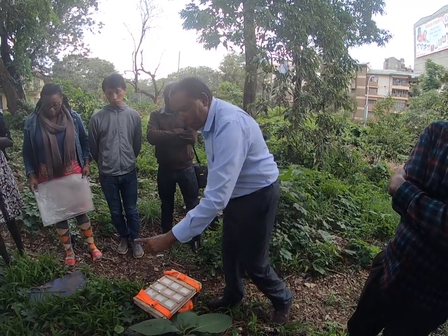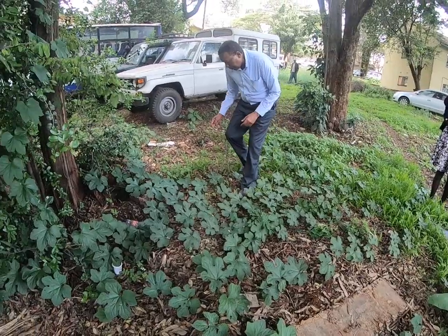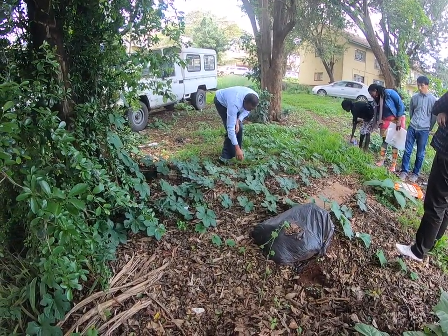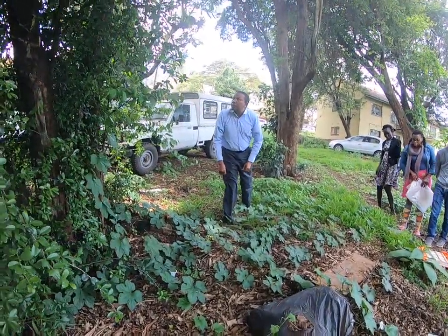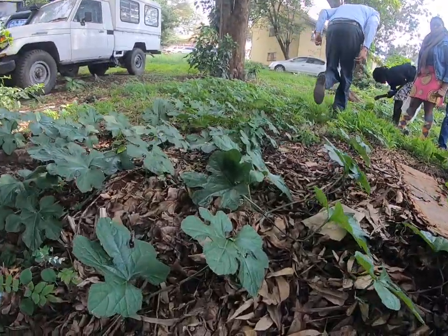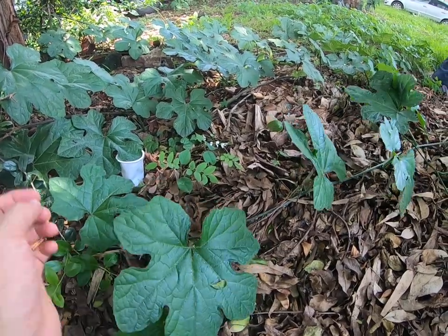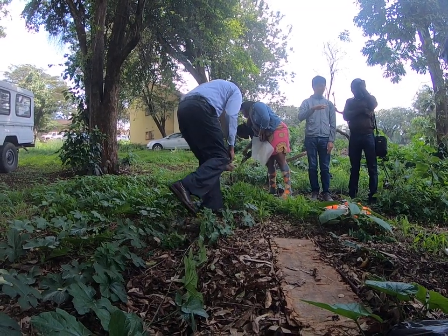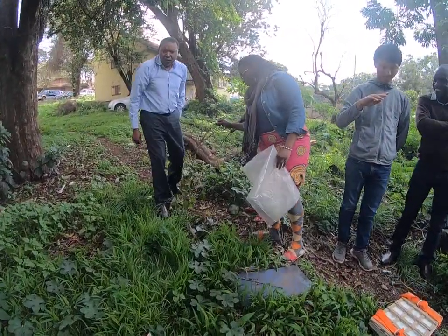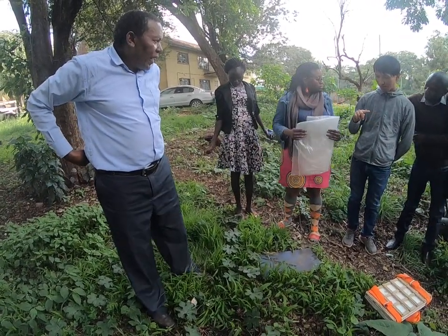So if you look at this plant, for example, this creeper, can you see any flowers? You can't find any. No flowers. Okay. Let's just try. No flower. Anyway, if there is no flower, then you are left with no other option. It's just to take what there is. In the absence of a flower, now you can take any part of the plant as a plant specimen.